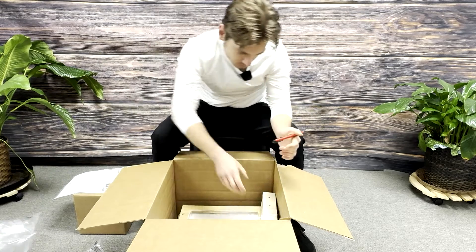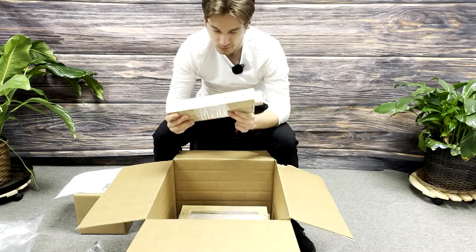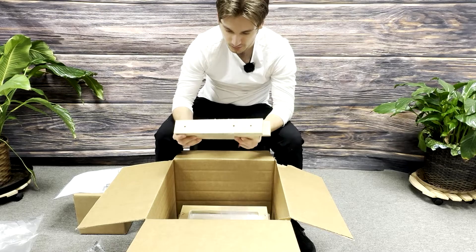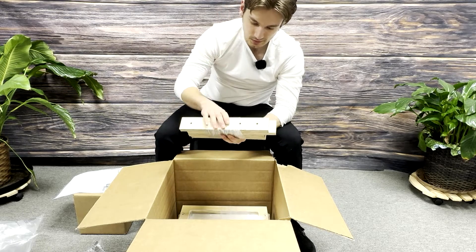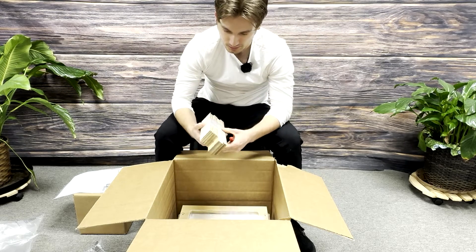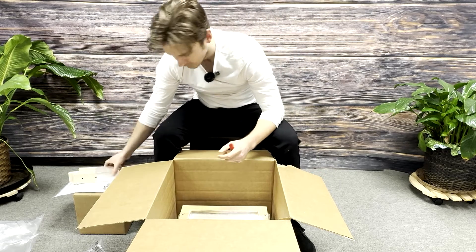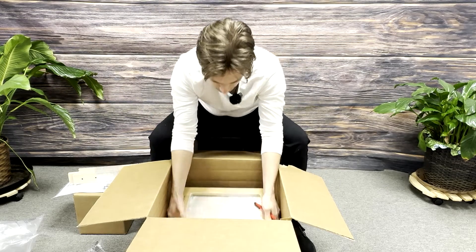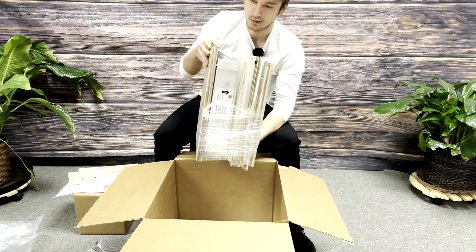These are your support brackets right below everything that we just took out. It's CNC pre-drilled for easy assembly, all you need is a screwdriver. And then below all of that is what is actually the bread and butter of your HEPA flow 12.